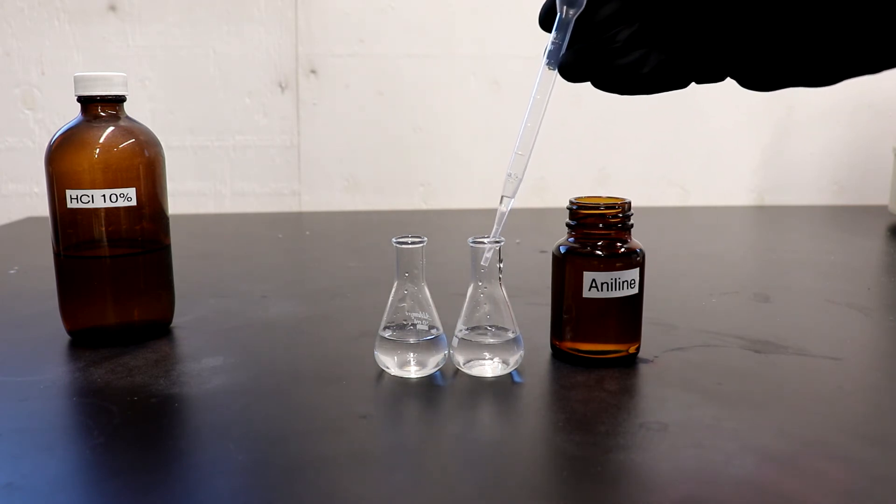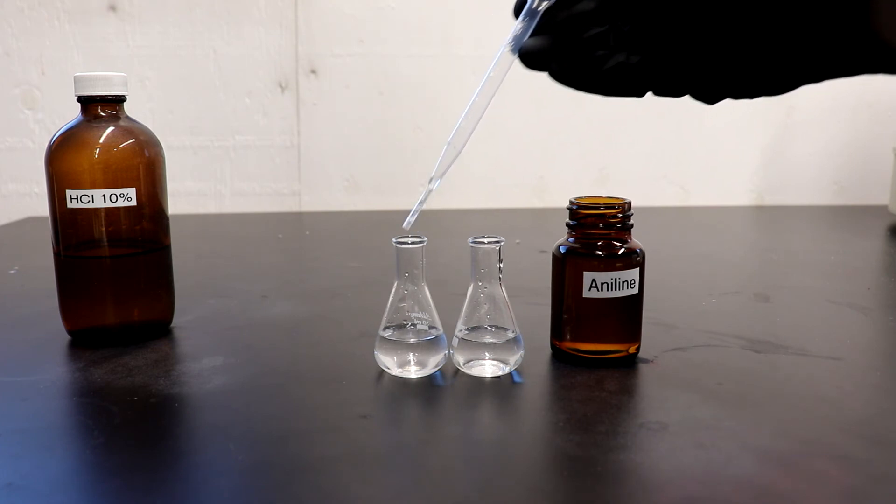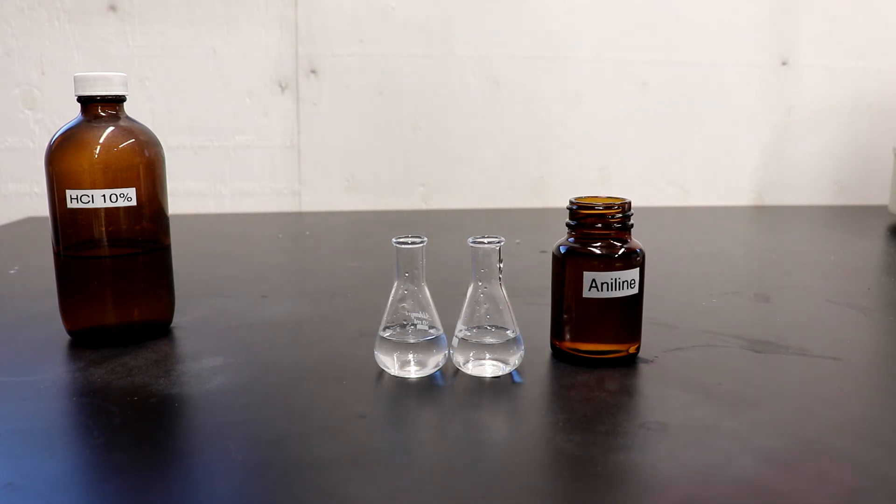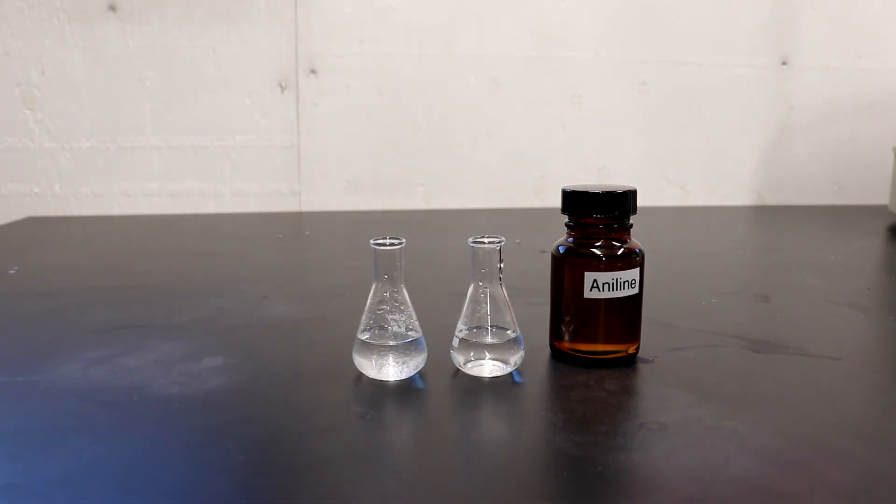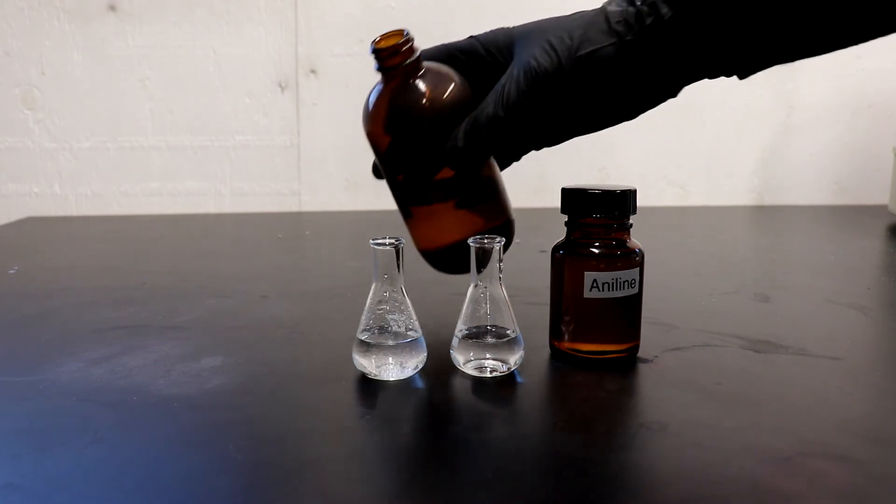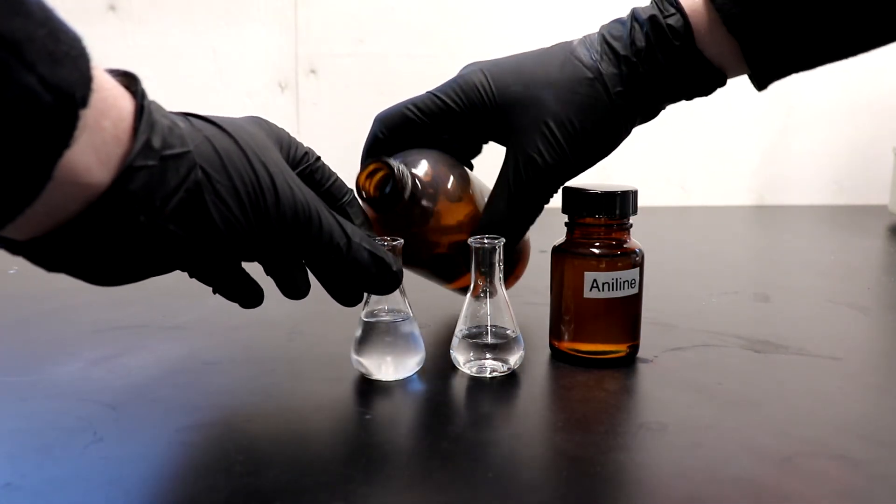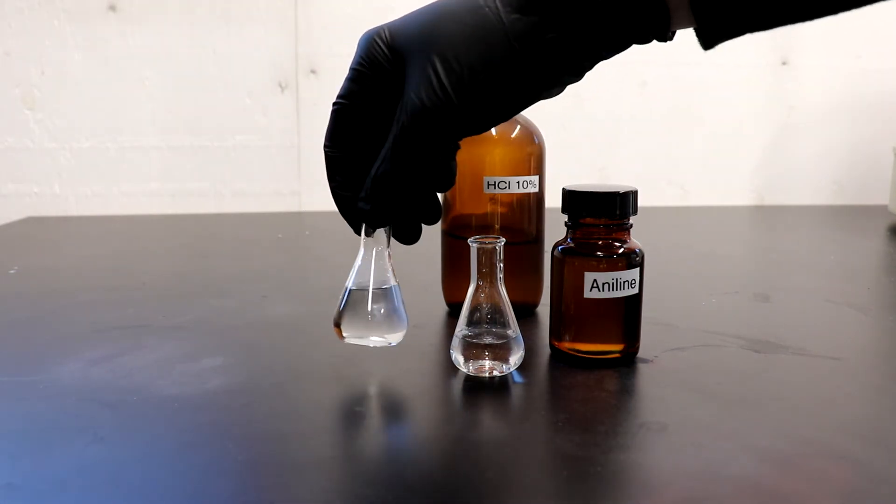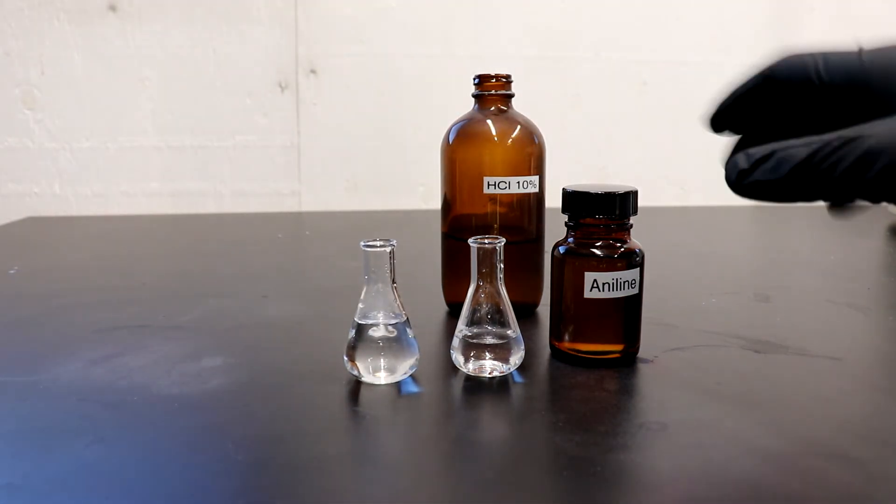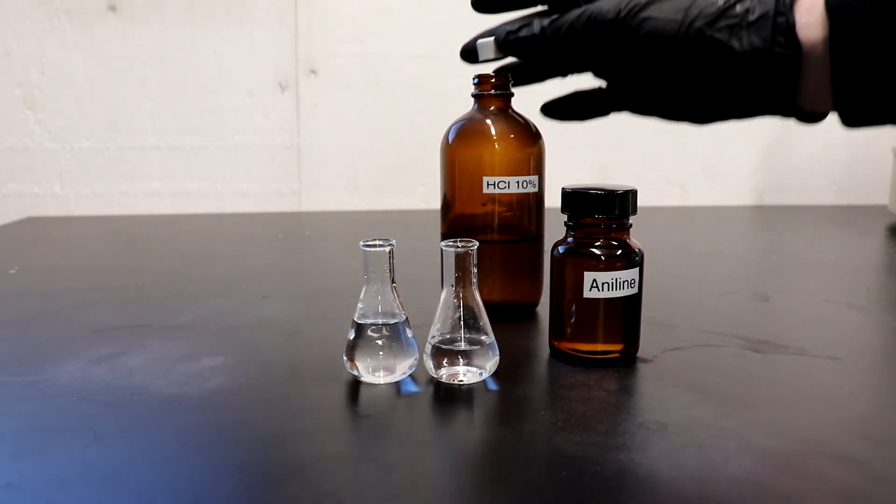So if we add it to water, you can see it's not really miscible. It doesn't dissolve that well. However, if we go ahead and add some hydrochloric acid, it should dissolve by producing the salt aniline hydrochloride. So if we just stir this around, and yeah, it's fully dissolved. So it's definitely basic, it definitely forms a salt, which is another plus towards it being aniline.